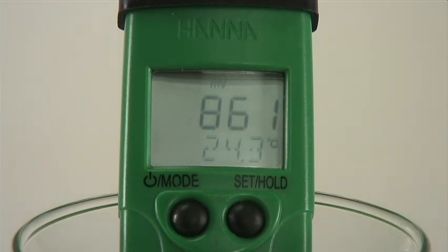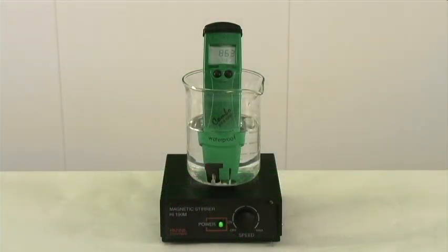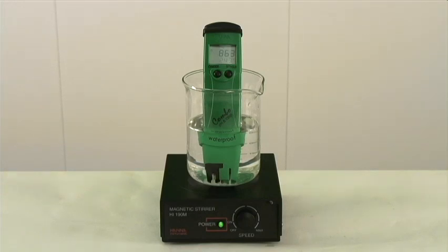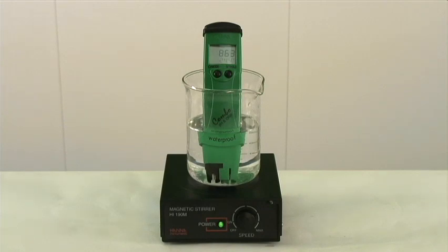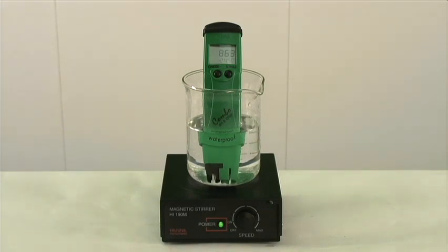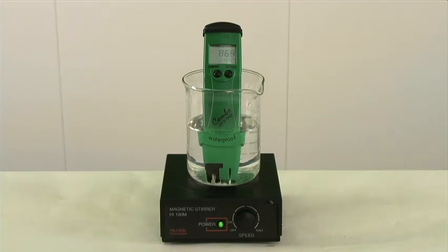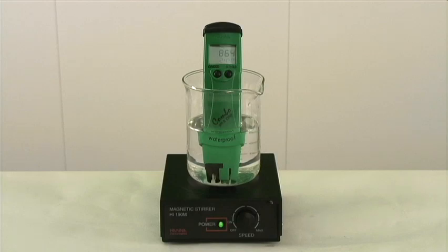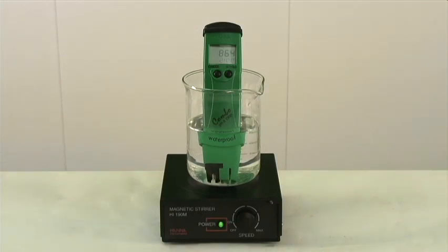Because we decreased the pH, hypochlorous acid was then the main constituent increasing the ORP and oxidizing potential. The same amount of chlorine was present before and after the addition of acid. The major constituent simply changed from hypochlorite ions to hypochlorous acid.